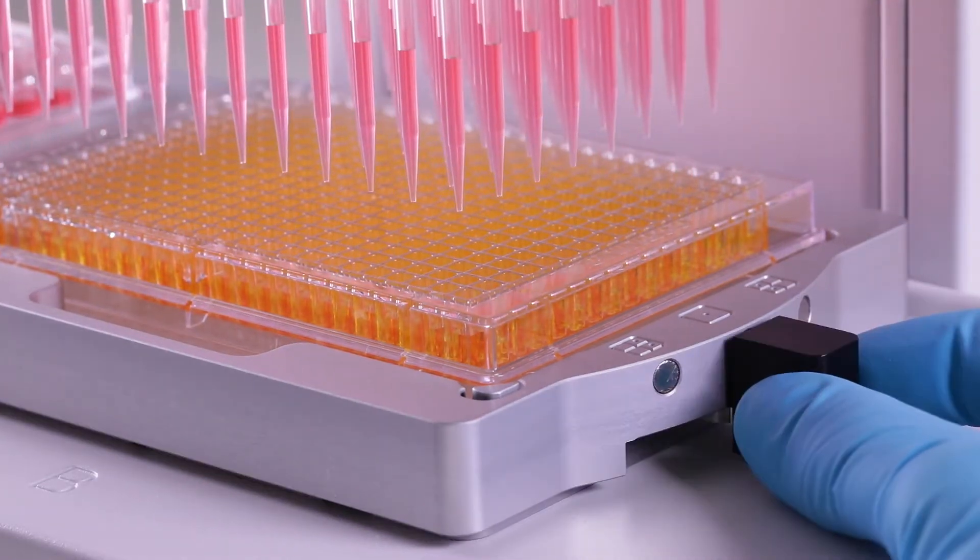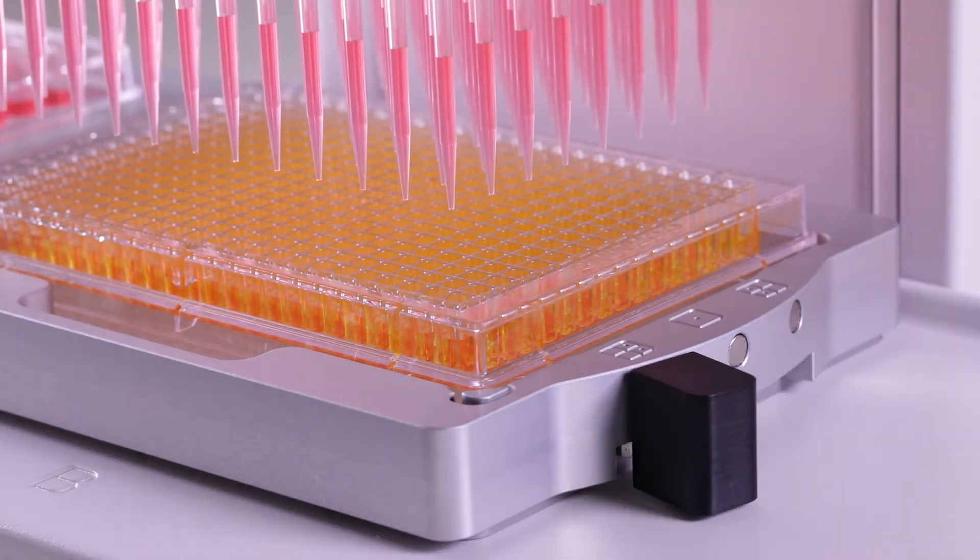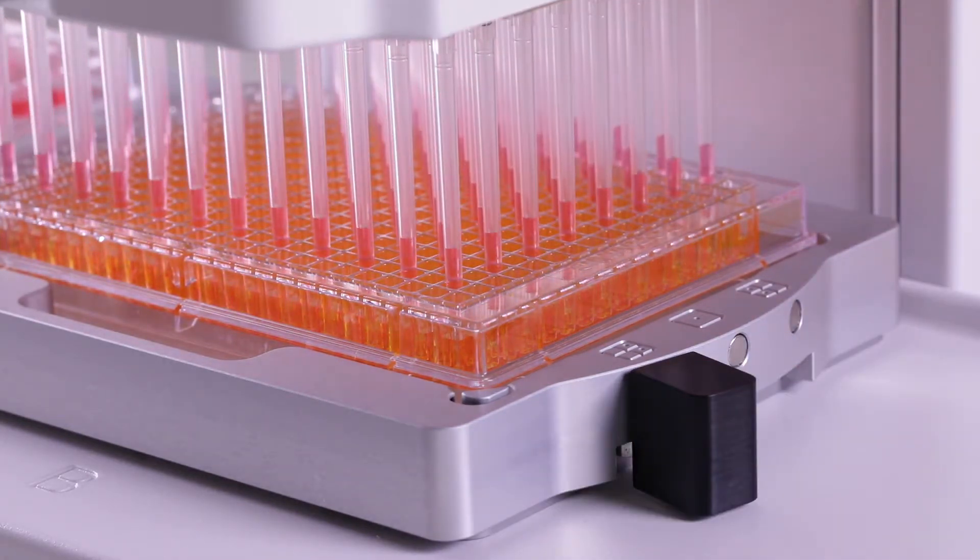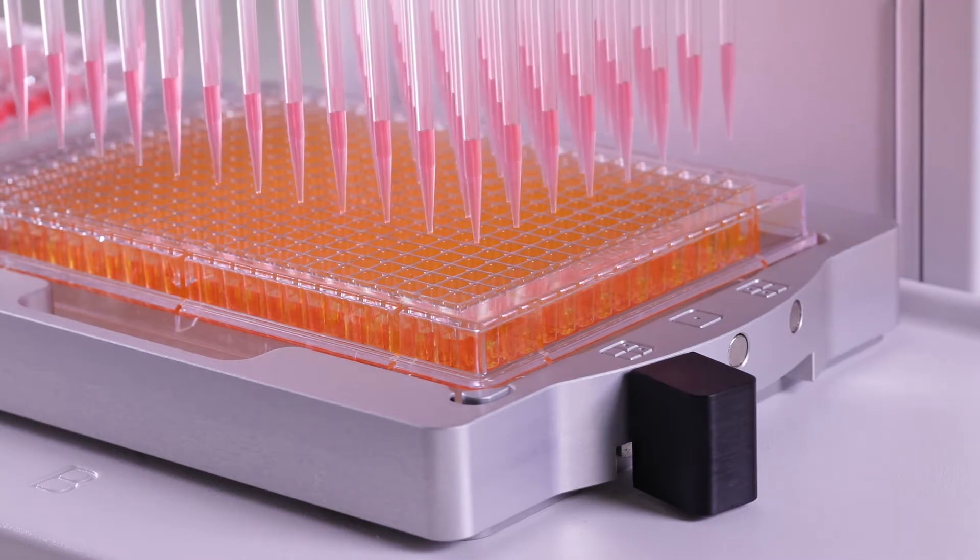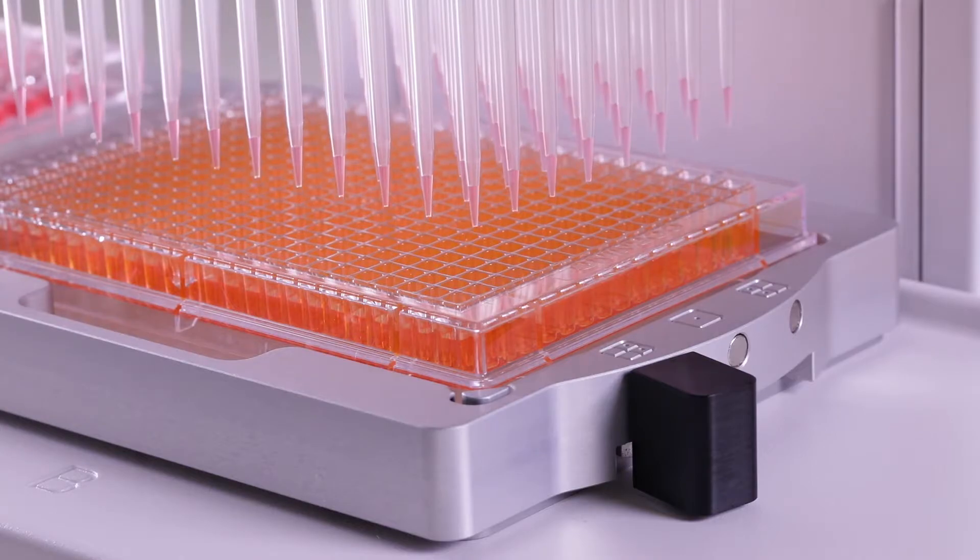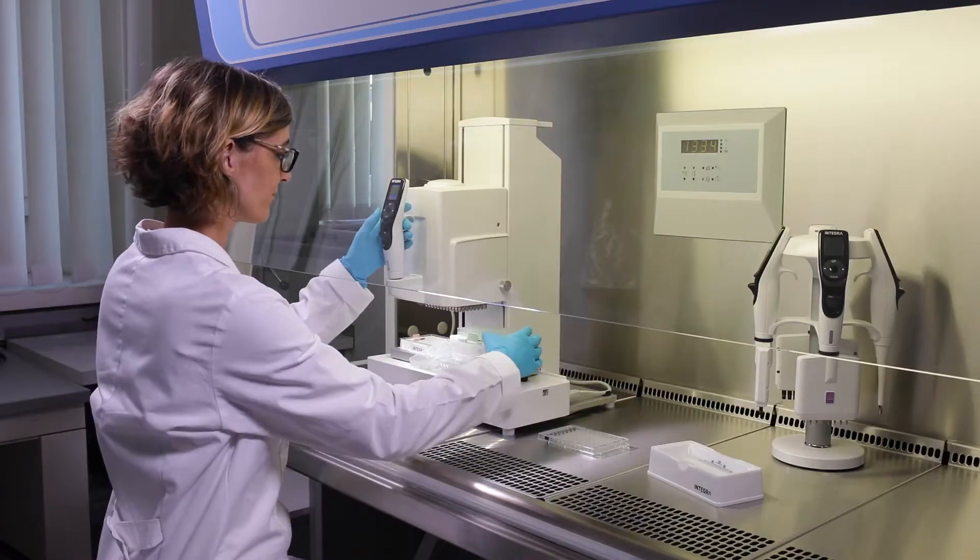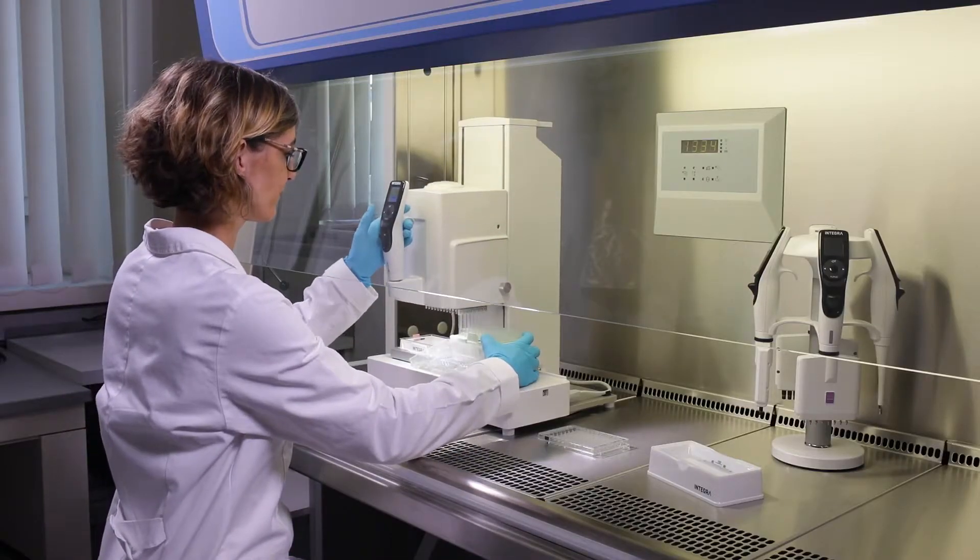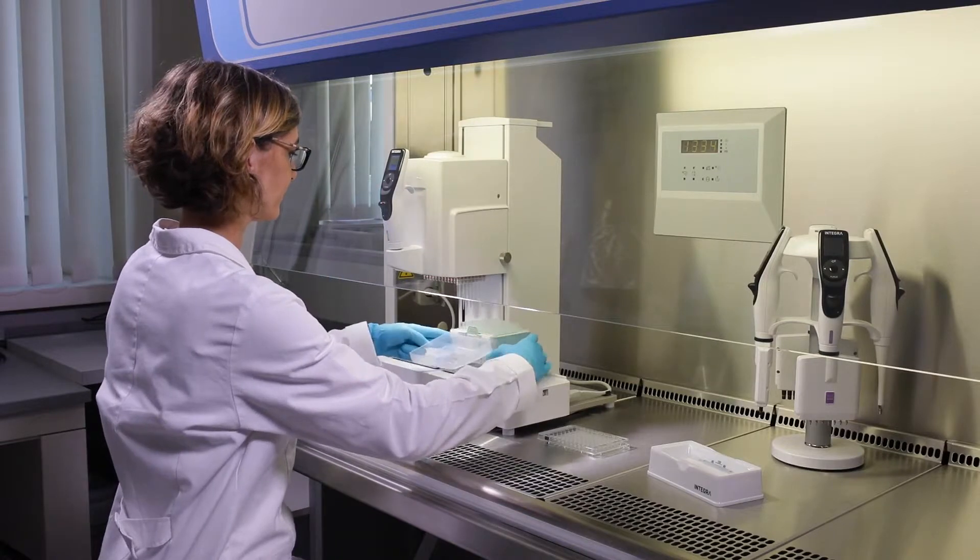Then shift the lever to the front to access the wells in the back. Even serial dilutions can also be performed, by simply partially loading the tips.